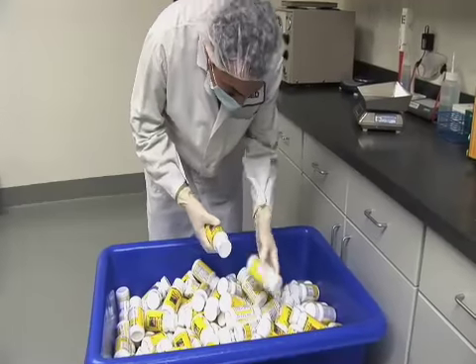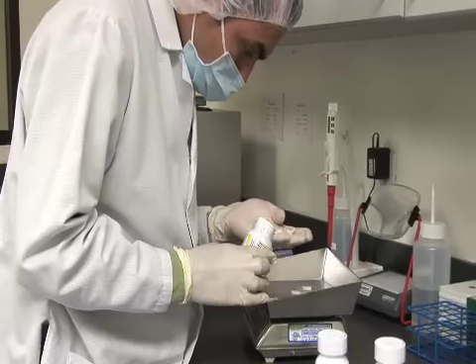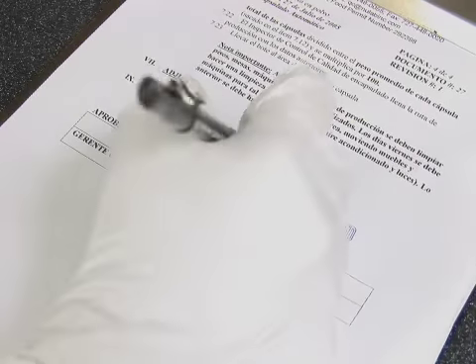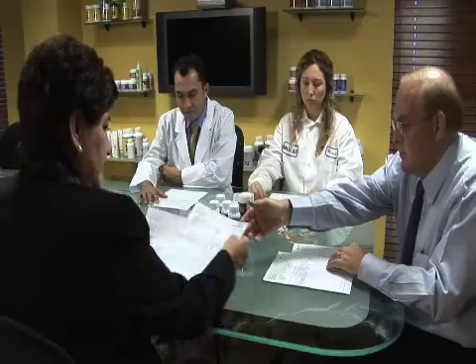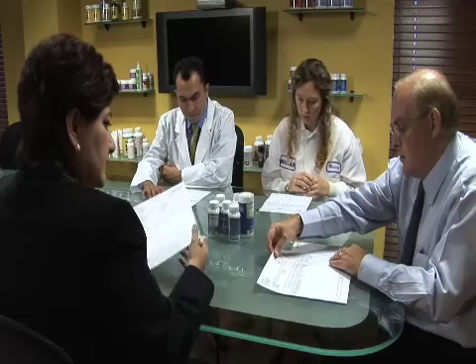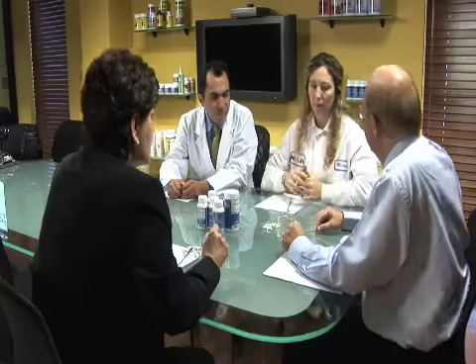The quality control director reviews the paperwork and orders an analysis of the batch. If all is in order, he gives his seal of approval. Only then can it be released to the finished products warehouse for shipping. Senior executives at Nulab have quality as their first priority. The CEO, general manager, and senior QC director routinely monitor the aspects of quality control.